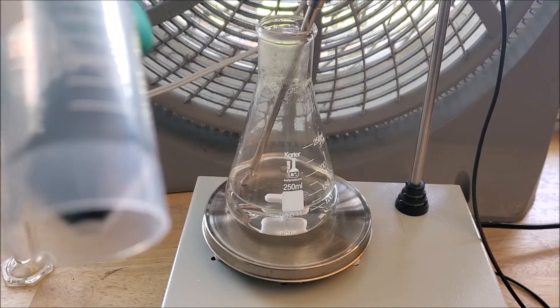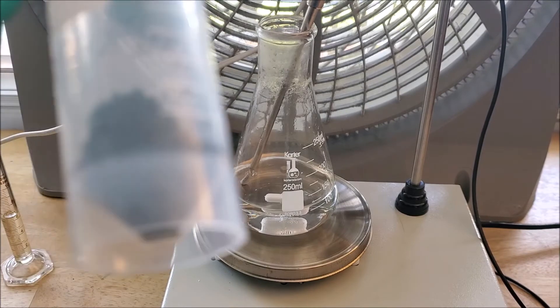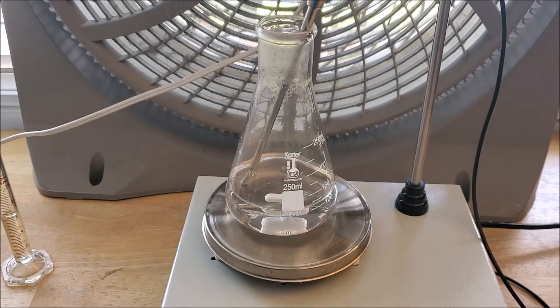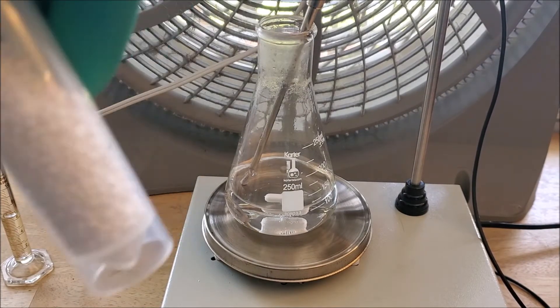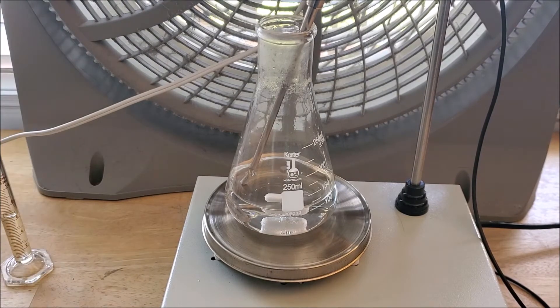Next thing you're gonna need is 20 grams of urea. I got this from not boiling my own piss, I got it from my school, but you can easily get it from instant cold packs. Here you can see I have it in these nice pearls. Powder would work just fine as well.